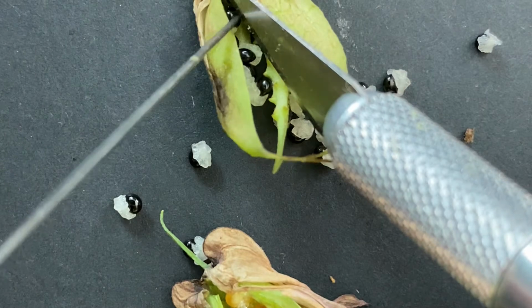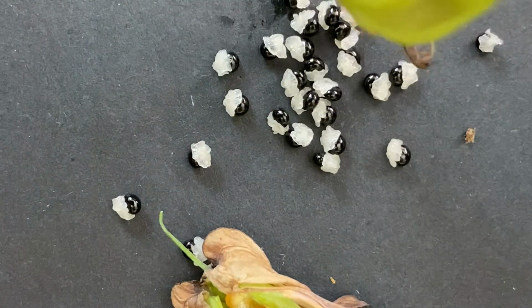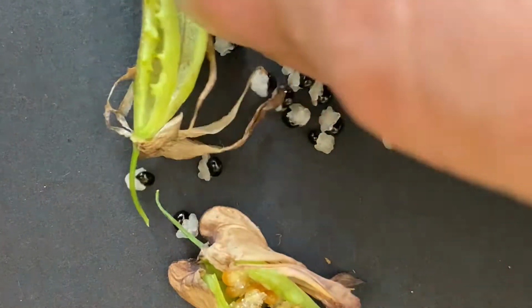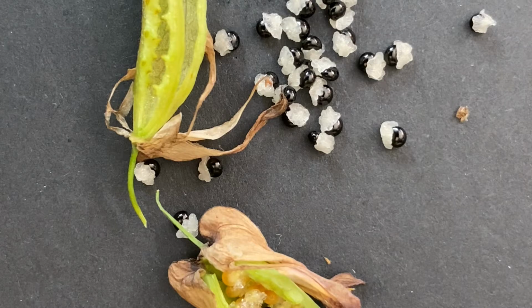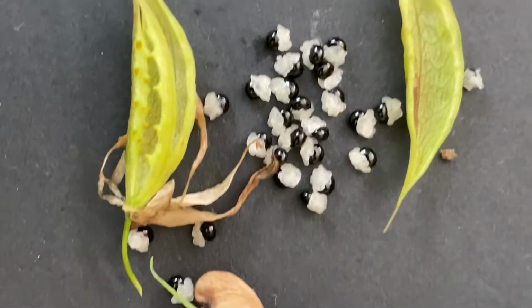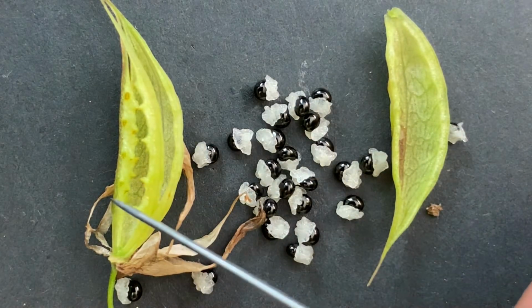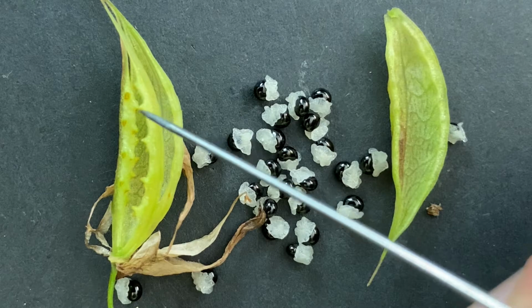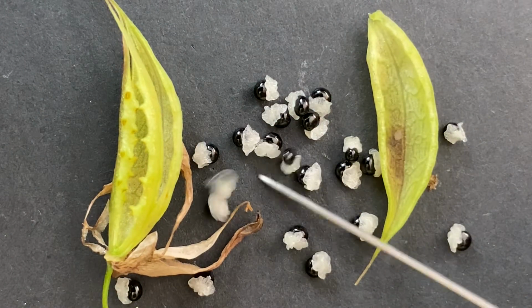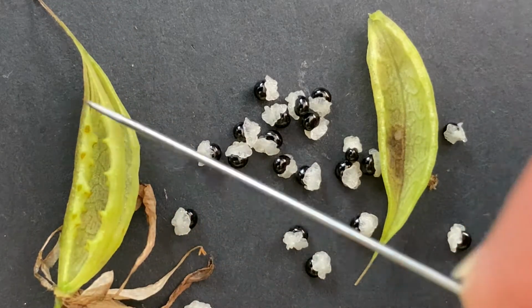And why is it ready to open? Because all of its seeds are black. Look at all these guys. So if we open up this one, they're all falling out because they have better places to go. They got to go plant themselves. You can see right here on the ovary where all these little bumps are, and that is where the ovules were attached. But now that they are black and they're ripe seeds, they are just ready to go and they don't need to be attached anymore.